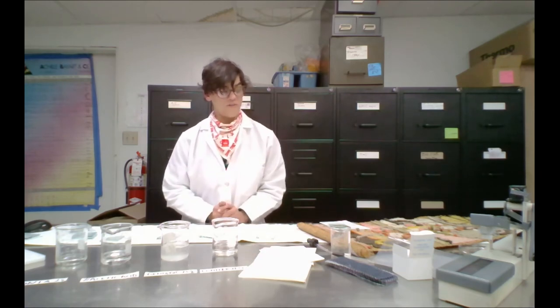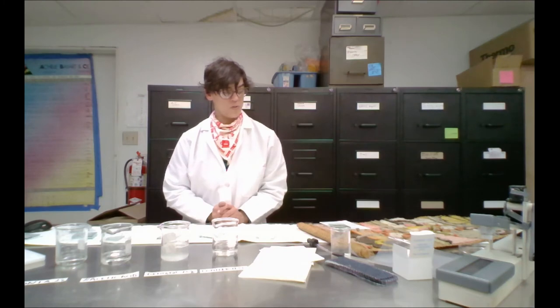Due to the time constraints, we're not going to be doing the detergent, acetic acid, or ammonia on the actual artifact today. But I hope I gave you a good idea of how you would do it if you were spot checking.